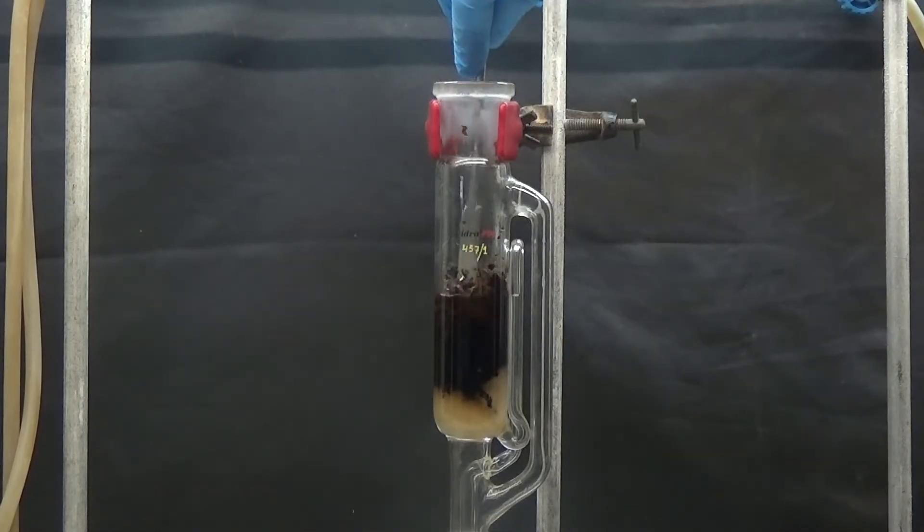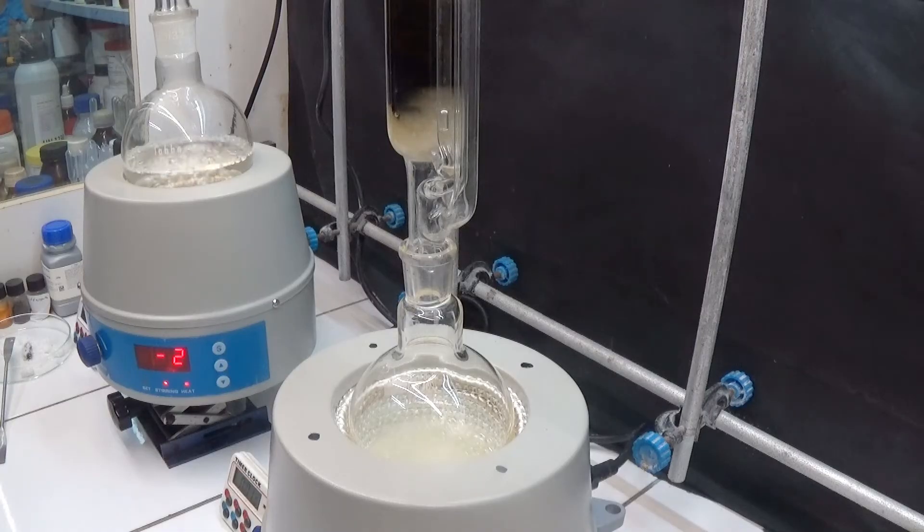After 3 hours of extraction, as the solid was not finely ground, I crushed it with a spatula in the extractor. The extraction lasted a total of 8 hours.